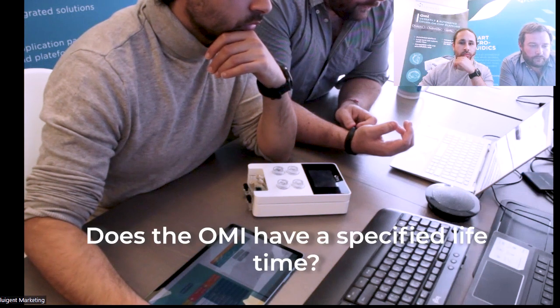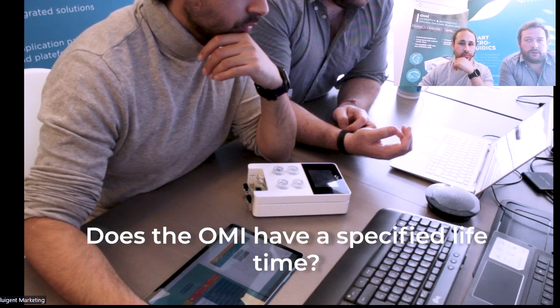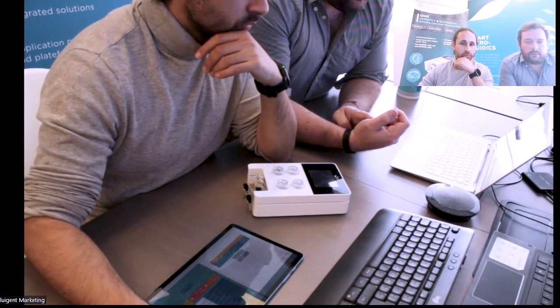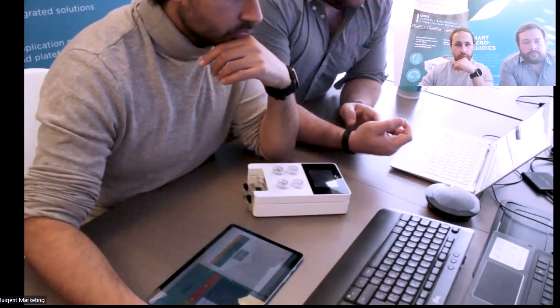On the lifetime of OMI, we have thoroughly tested it for weeks in a humid incubator, so saturated humidity at 37 degrees. So far we have OMI that has survived for months now. We don't have enough feedback to precisely answer the full lifetime. If you take the components one by one, it's definitely more than 1 year, which is the warranty of the machine.